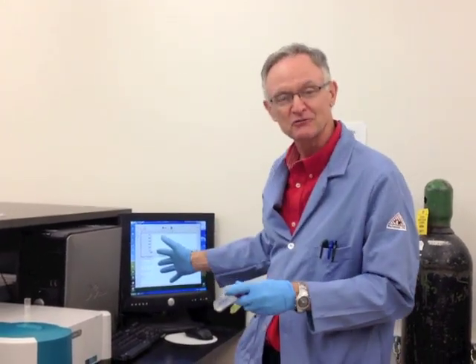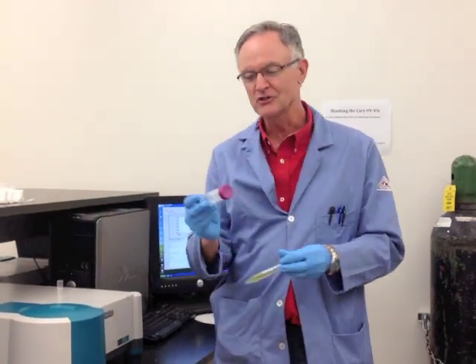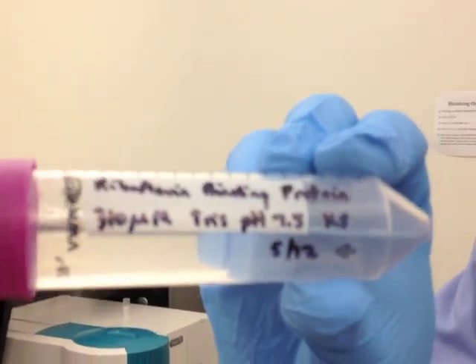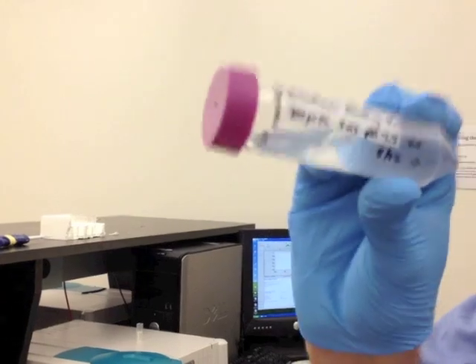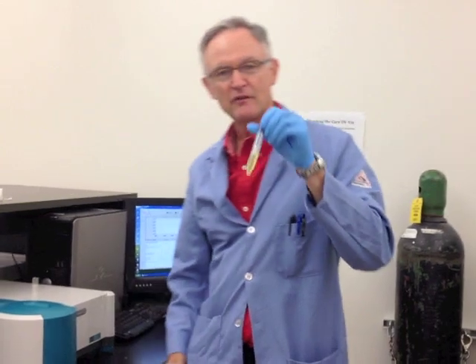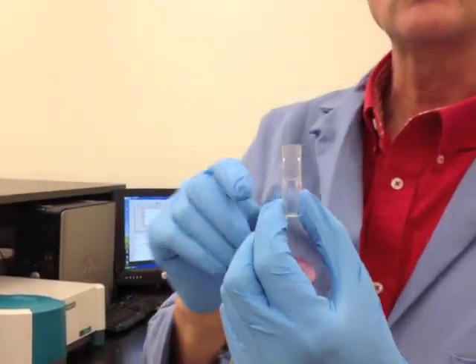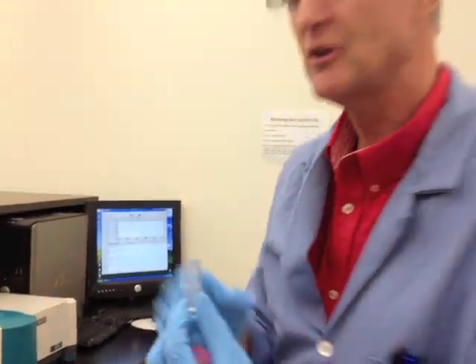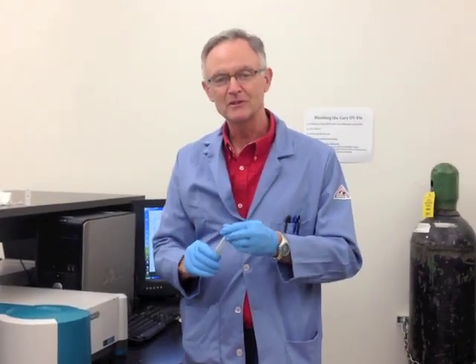We're here in the lab, ready to do the experiment. Marie's going to demonstrate in a minute. We've got the spectrophotometer all set up to go. We're going to do a trace from 400 to 700 nanometers. We've got our two solutions: riboflavin binding protein and neutral red. The cuvette goes in the spectrophotometer so the light goes through the clear side. We've already diluted the neutral red in our cuvette. Be sure you put it in the spectrophotometer in the right direction. We're all ready to go.